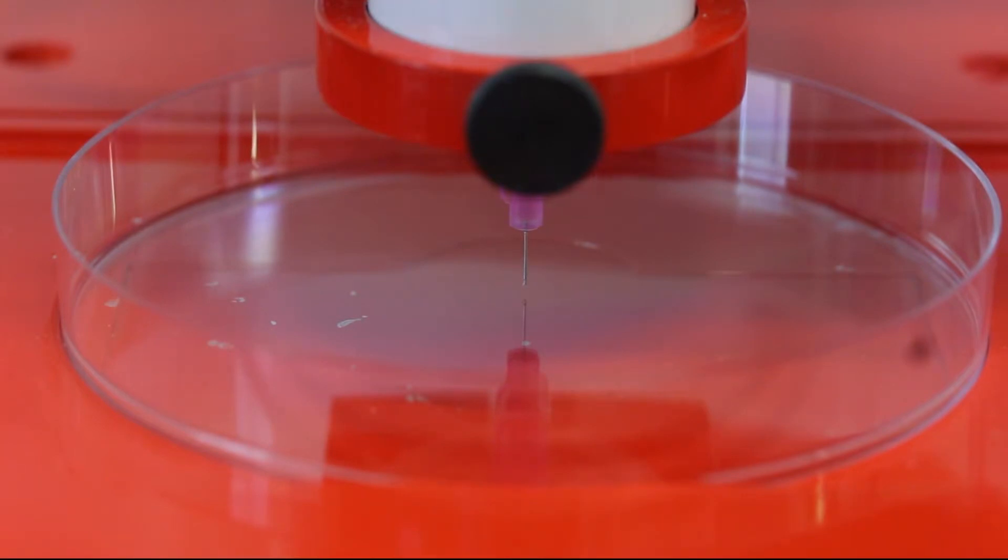Click the extrude button under extruder 1 to test if the needle touches the plate while extruding. A well calibrated needle should just barely touch the plate without causing it to bend.